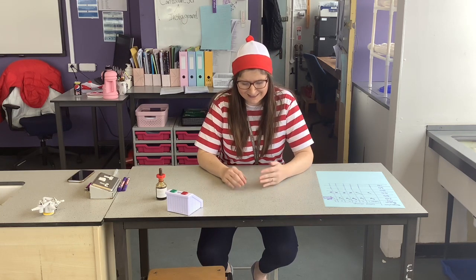What you would do then is repeat your experiment for 30 degrees, 40, 50, 60, 70, and you'll see the effect temperature has on the enzymes. Inaccuracies of the experiment would be that it's really hard to see the colour change when you're deciding, is it black, is it blue, has it actually changed colour and by how much. So to get over that and to improve it, we would use a colorimeter.